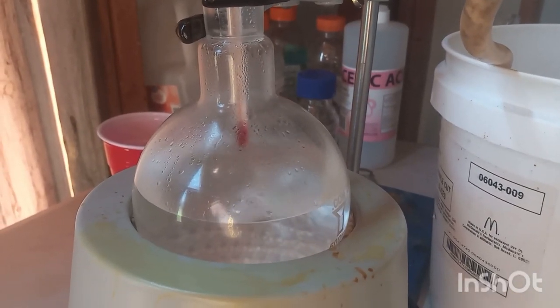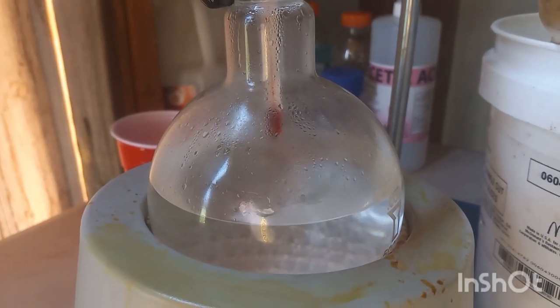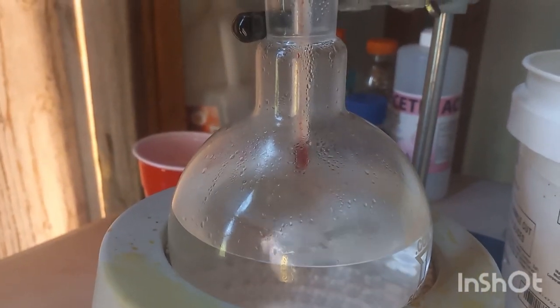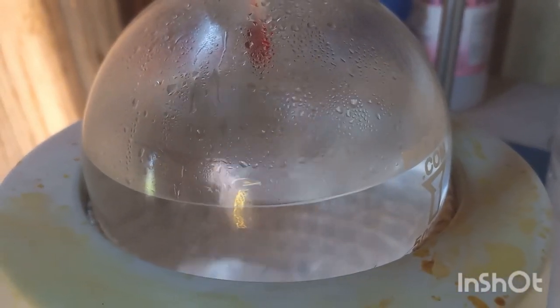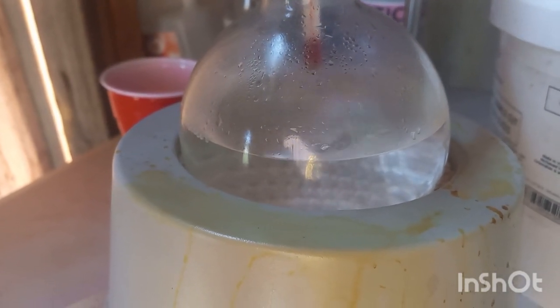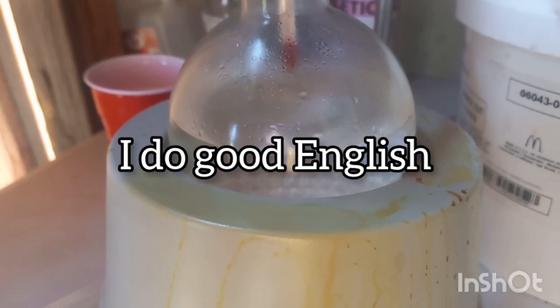Alright, here we go. Looks like it's gone a little cloudy. It is starting to reflux. It says reflux for 10 minutes at 70 C, so we're going straight for distillation, hoping the difference in time and temperature will be made up. The transesterification catalyst has been made, and we're just waiting. There are some bubbles. I'm hoping that's slight boiling and not catalyst destroyed or product destroyed. So I guess we'll see.